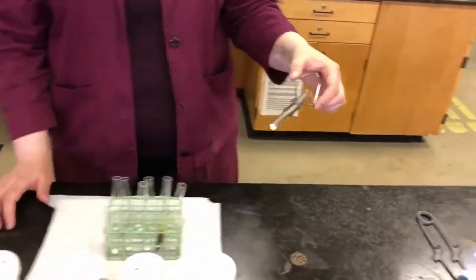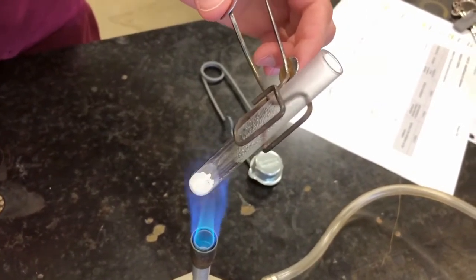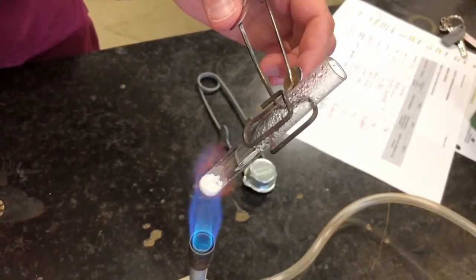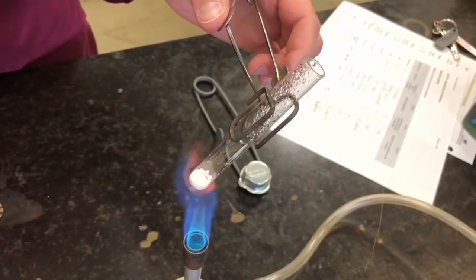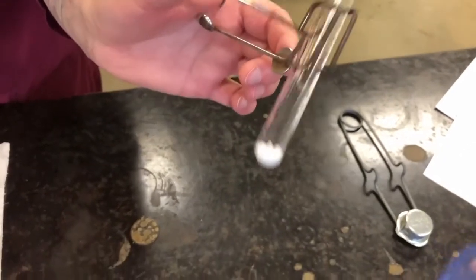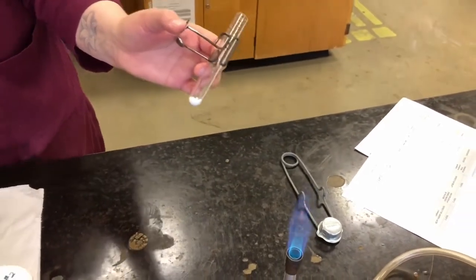Next we have Epsom salts. Another white, colorless crystal. Now this one you can hear a sound again. It's giving off steam, so you see that condensation at the top of the test tube? That's from water vapor being given off. There's liquid forming around the inside surface of the test tube. If I take it out, you can see that the substance on the bottom has actually solidified. So it gives off steam, it produces a liquid vapor, and it turns into a solid residue at the bottom. So that's Epsom salts.